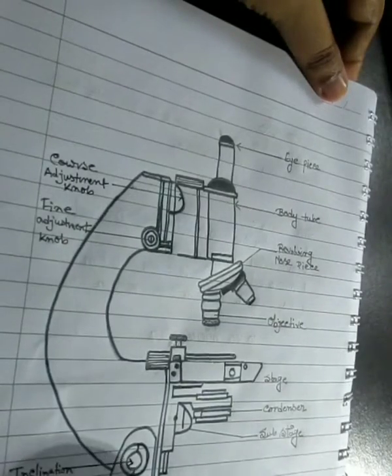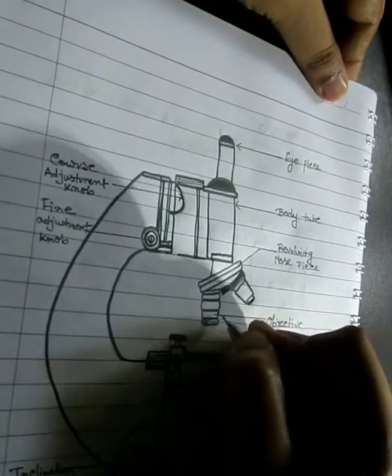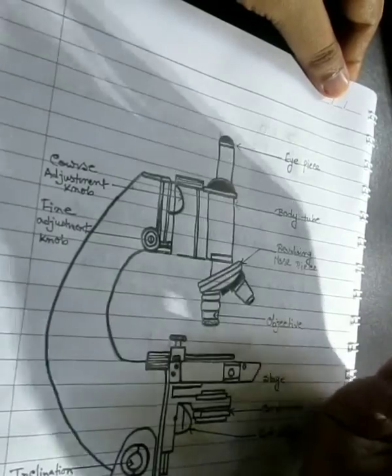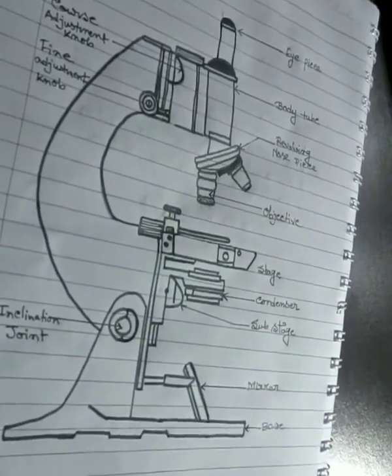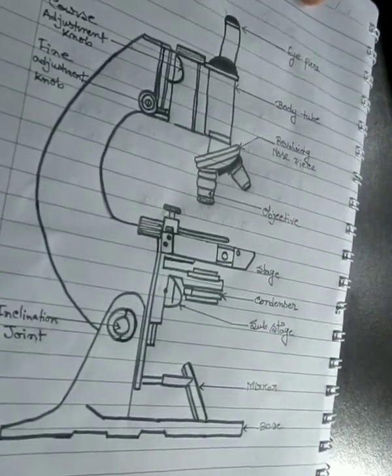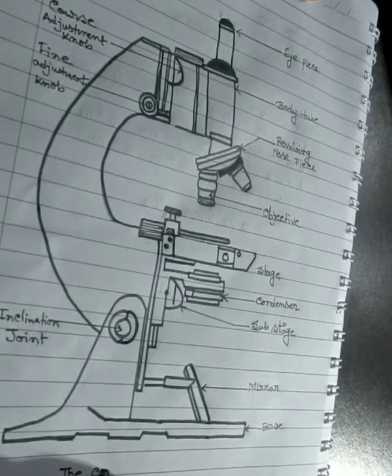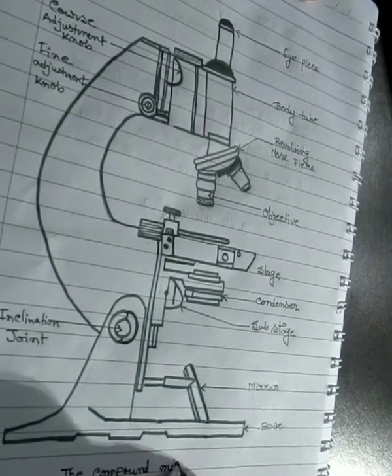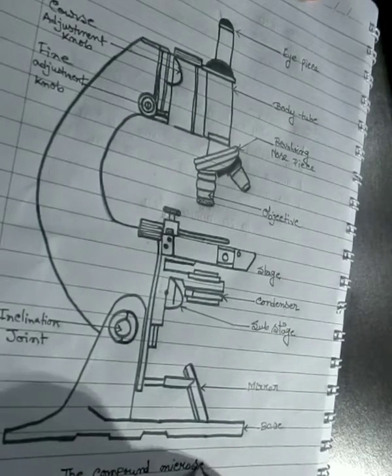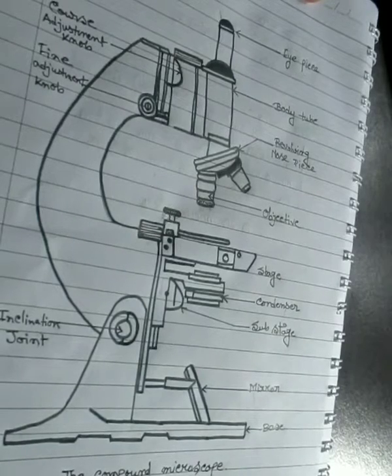A compound microscope includes the condenser lens, the objective lens, and the eyepiece lens. The objective lens is responsible for producing the magnified image and is available in different magnification varieties from 4x to 100x.